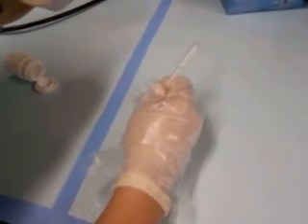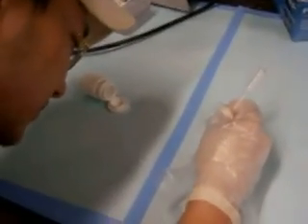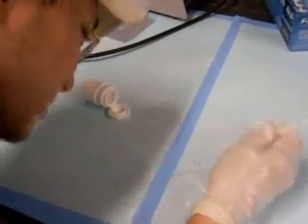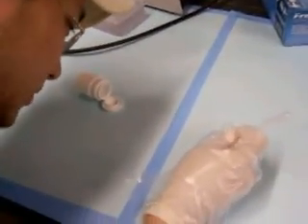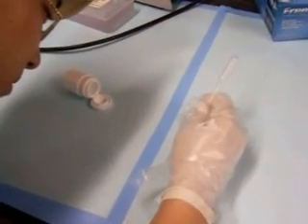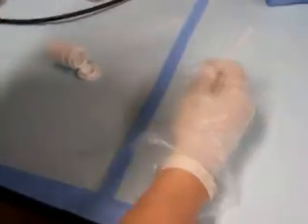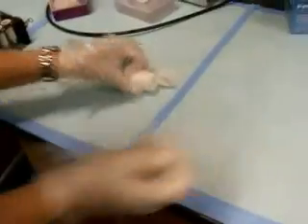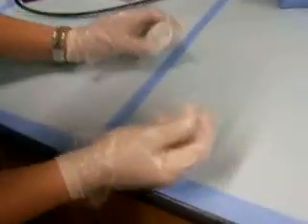Do you have any words that you'd like to say to the perpetrator who caused this nasty accident? My first question will be, state your name. State your address. And then I'll ask about their activities and whereabouts and confirming sources for the dates from May 17th to May 27th. It's a time period that spans between the group cleanup and today. I should mention that all these pretty blue diapers which the spill is on top of were placed on this counter on May 17th. Therefore, we know that this accident occurred after that day.